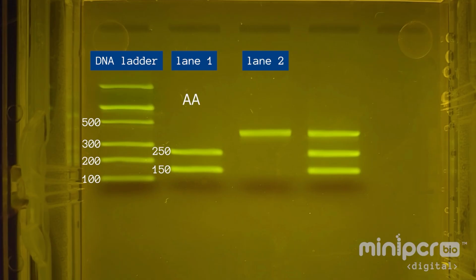In the second lane, we see one band. The band has traveled farther than the 500 base pair band in the ladder, but not as far as the 300 base pair band. Based on the design of our experiment, we can infer that this band contains the 400 base pair DNA fragments associated with the sickle cell allele. Because this sample contains only the sickle cell allele, we know this individual has the SS genotype that indicates sickle cell disease. Note that while this person does have two copies of the sickle cell allele, all the DNA fragments are the same length, so there is only a single band on the gel.